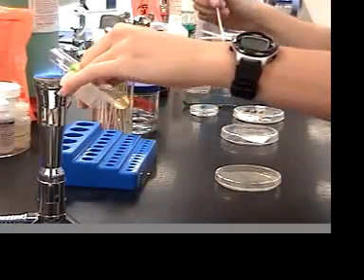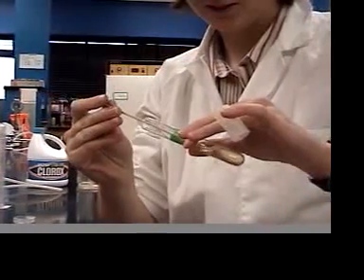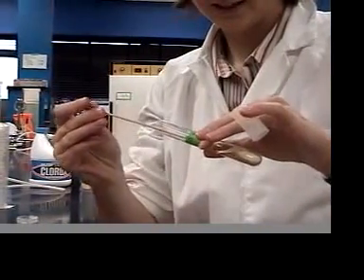First, divide your plate into four quadrants, and then inoculate your plate with whichever organism you're testing.